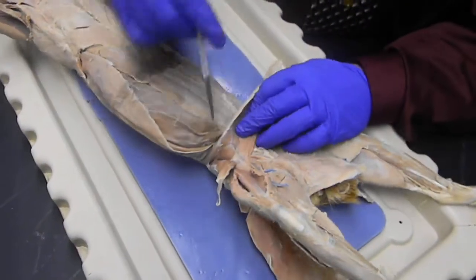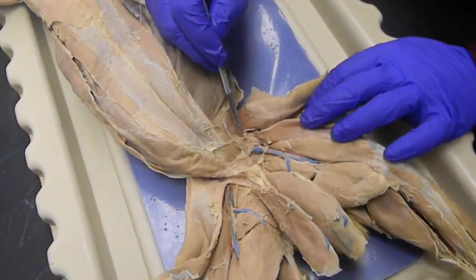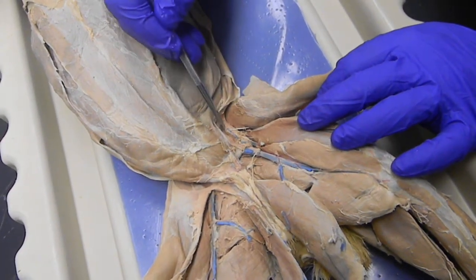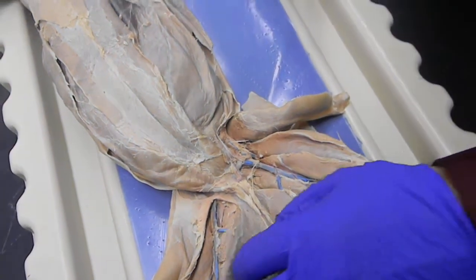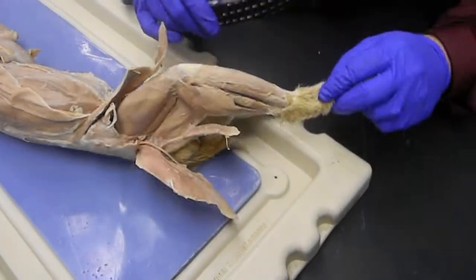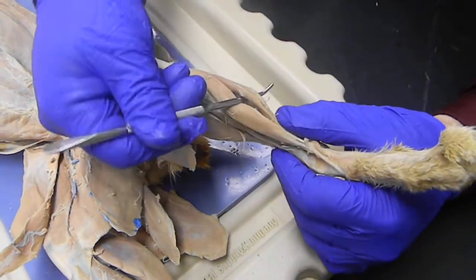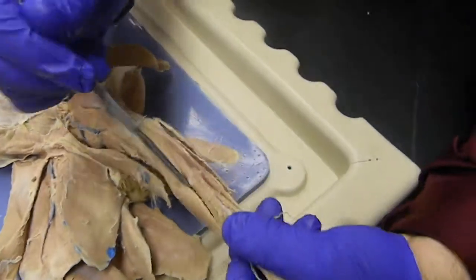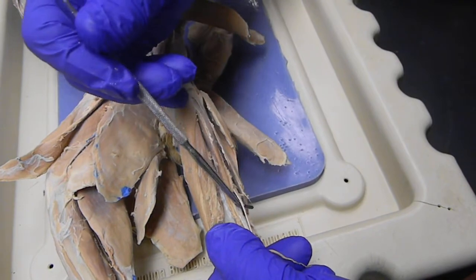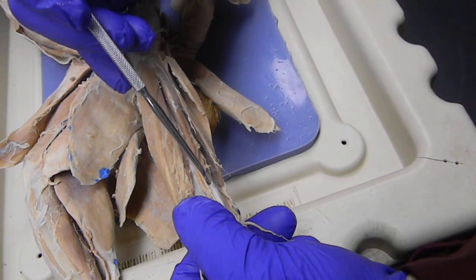We have a muscle right here, above the veins and arteries, a big lump of muscle with the femoral nerve coming out of the center of it. Right there is the iliopsoas. Down on the leg. Yuck. Let's try this one. Okay. The tibialis anterior, right in front. The one right behind it is the extensor digitorum longus. Then off to the side is the peroneus group. First one is the peroneus longus. Next tendon down, very thin, is the peroneus tertius. The muscle that's on the bone right there, really wide, is the peroneus brevis.